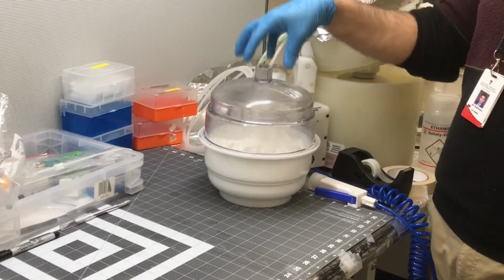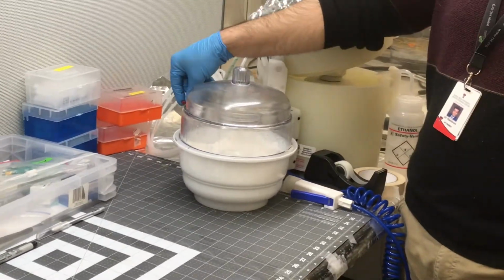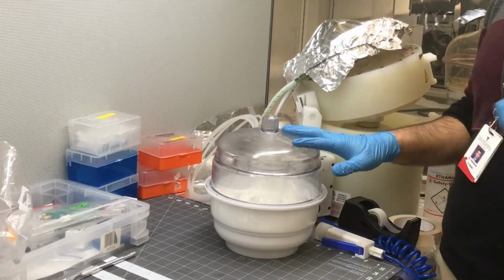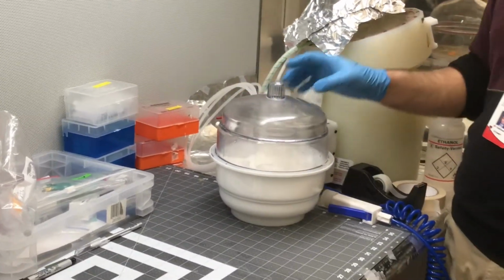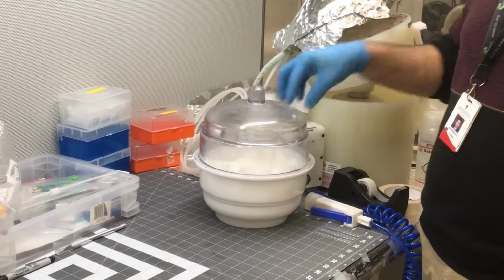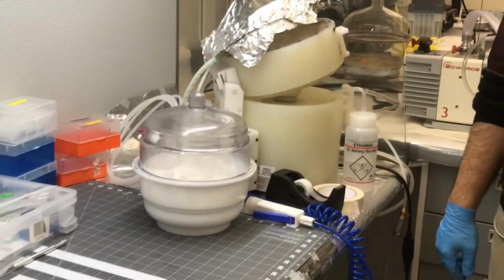Otherwise, because I remove the pressure and close it, this affects the PDMS, and the PDMS changes to semi-solid inside the vacuum. So that's the reason you should not keep the PDMS with the curing agent inside the vacuum too much time. That's a very important point. Have you written this down, Ashwin? Okay.